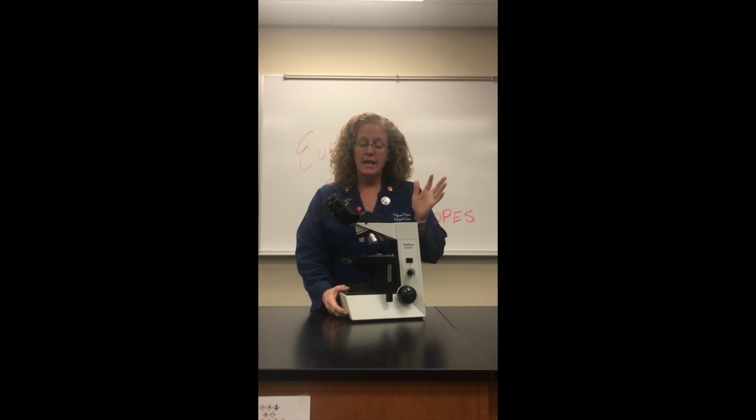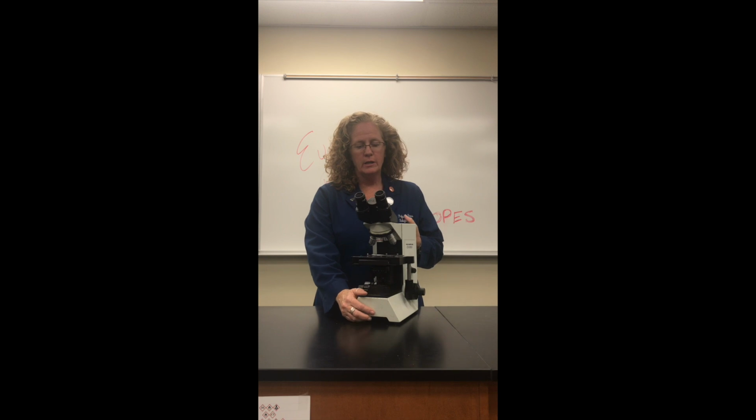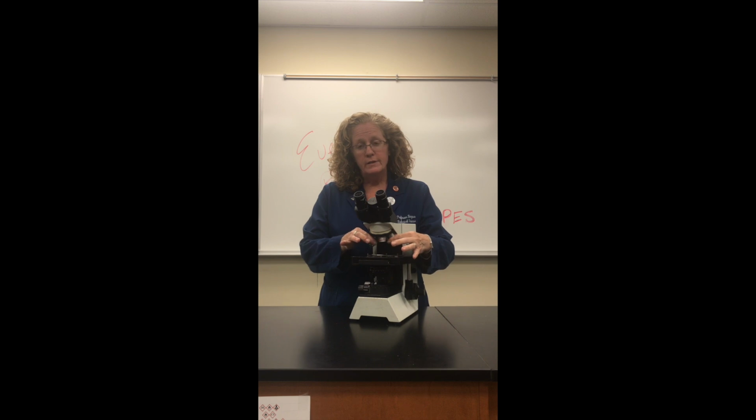I'm Professor Burgess, and I'm going to show you how to use a microscope. So what we have here is a binocular compound microscope. It's called binocular because we use two eyes, and it is compound because we magnify an image twice. Once using what we call the objective here, where we control how much magnification, and a second time through the actual eyepieces up here called the oculars.